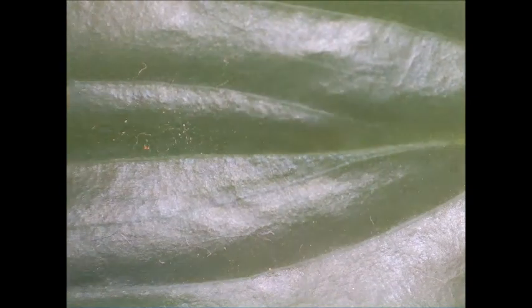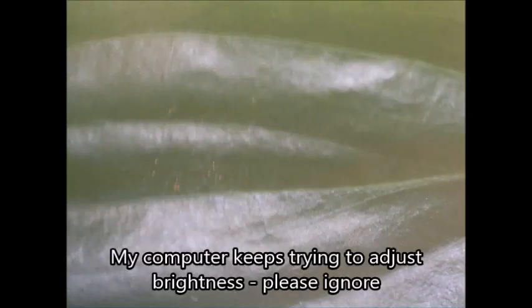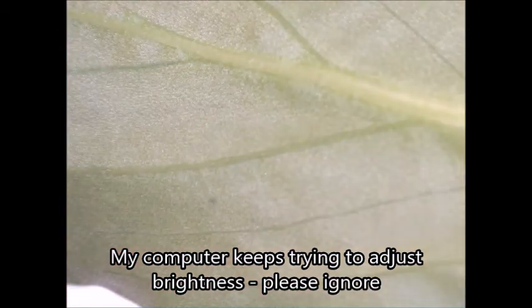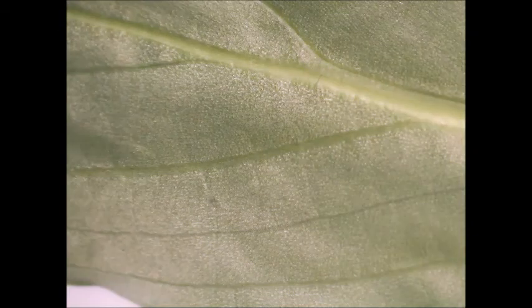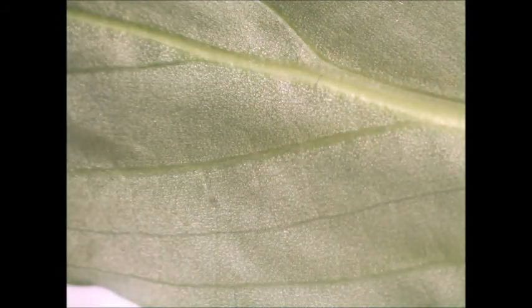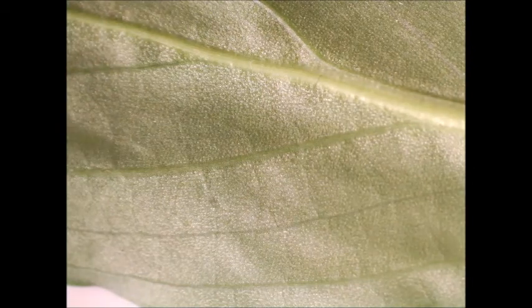And now I'm going to use that fine focus, which is on the barrel of the microscope. See, it goes past it. And okay, so it seemed like we had it pretty good. So there's the leaf. It looks very plasticky. I'm going to turn it over. Let's look at the bottom. Ooh. So the bottom looks a bit fluffier than the top.